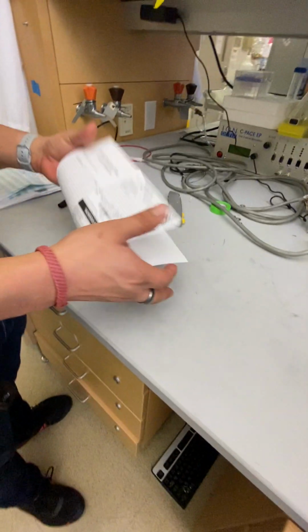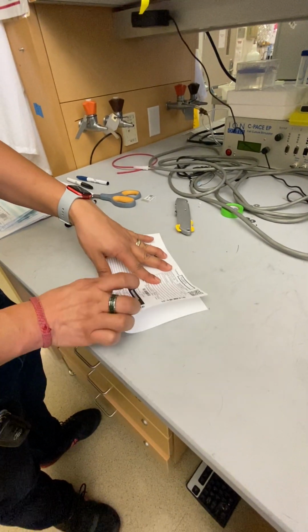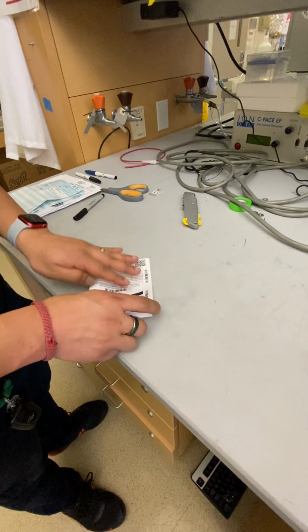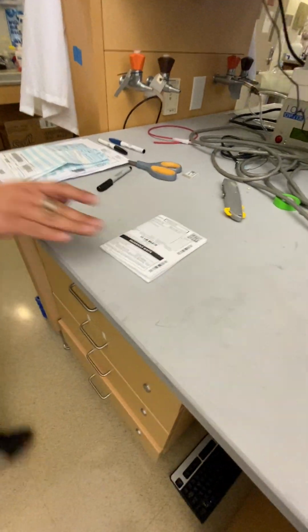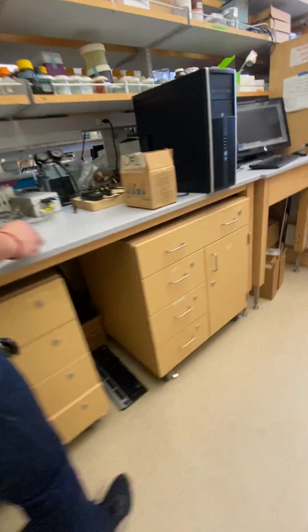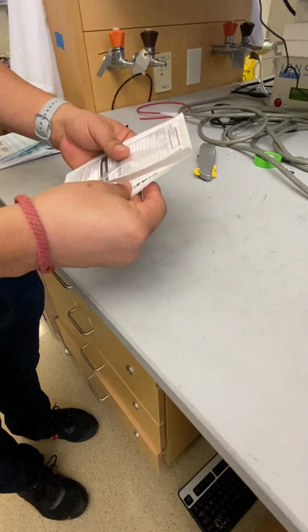All right, so then once you have it printed, you fold it on the lines into fourths. All right, and then you come over here underneath the microscope, or underneath the laser side of the microscopes, on the second shelf, nope, on the first shelf, we have these sleeves. Our safety manager is in charge of procuring more of these, so if you ever run out, just talk to your safety manager. Slide them in with the details of the chemical pointing out.